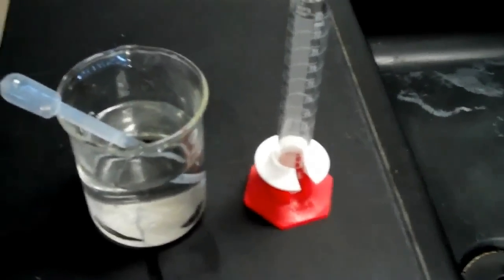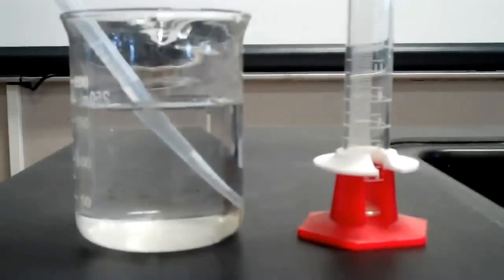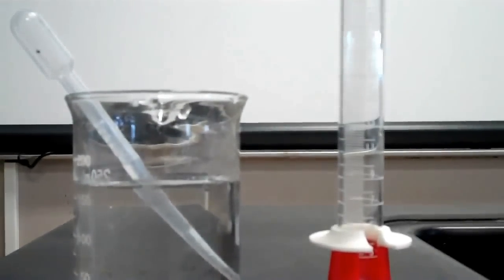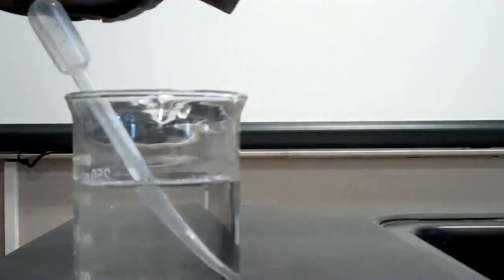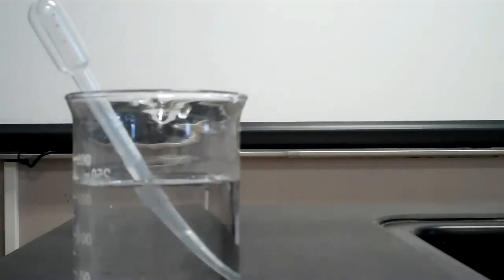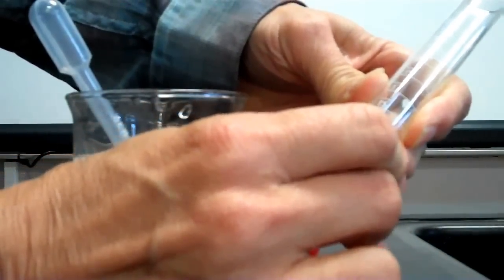So first what I will do here is I'll start with a certain amount of water in my graduated cylinder. I'm going to start at the 10 milliliter mark, which is right about there.